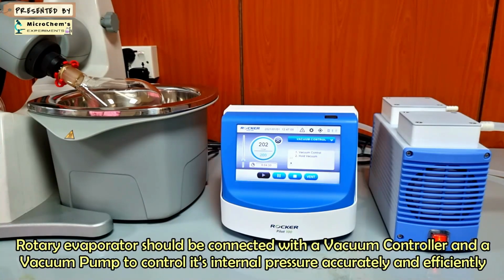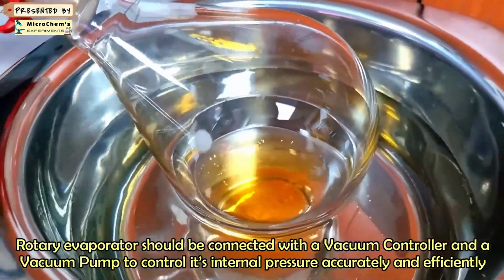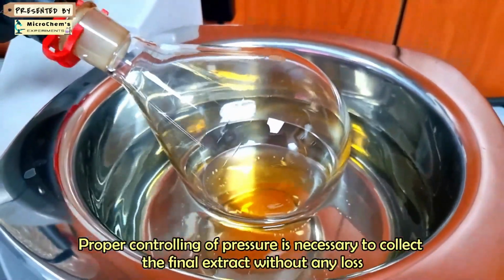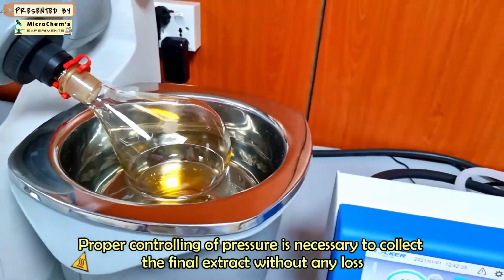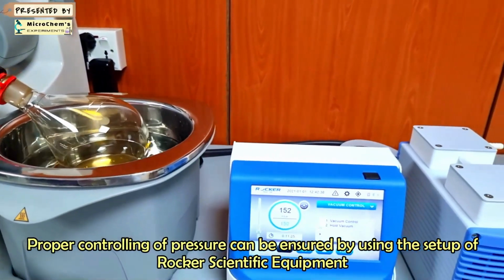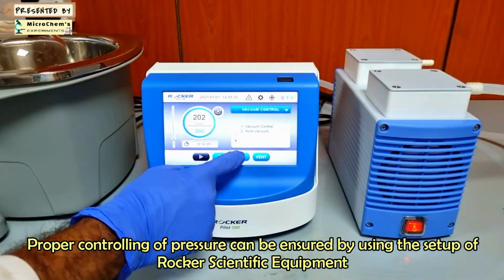A rotary evaporator should be connected with a vacuum controller unit and a vacuum pump to control its internal pressure accurately and efficiently. Proper controlling of pressure is necessary to collect the final extract without any loss. Proper controlling of pressure can be ensured by using the setup of ROCKER scientific equipment.